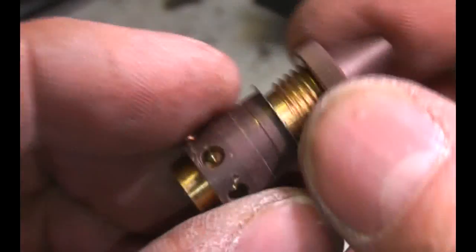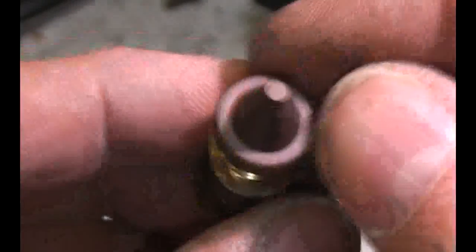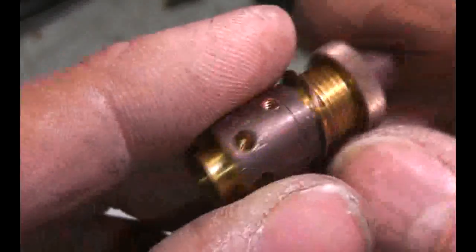With x-rays you can't focus them, so the only way to produce a really tiny spot is to shine it through a very small tube, which is very inefficient. It's not surprising there's no extra lead around there because the amount of x-rays getting through would be minuscule. There's maybe some lead lining on the tube assembly itself, but by the time it gets here there's so little x-ray that it's essentially zero hazard.